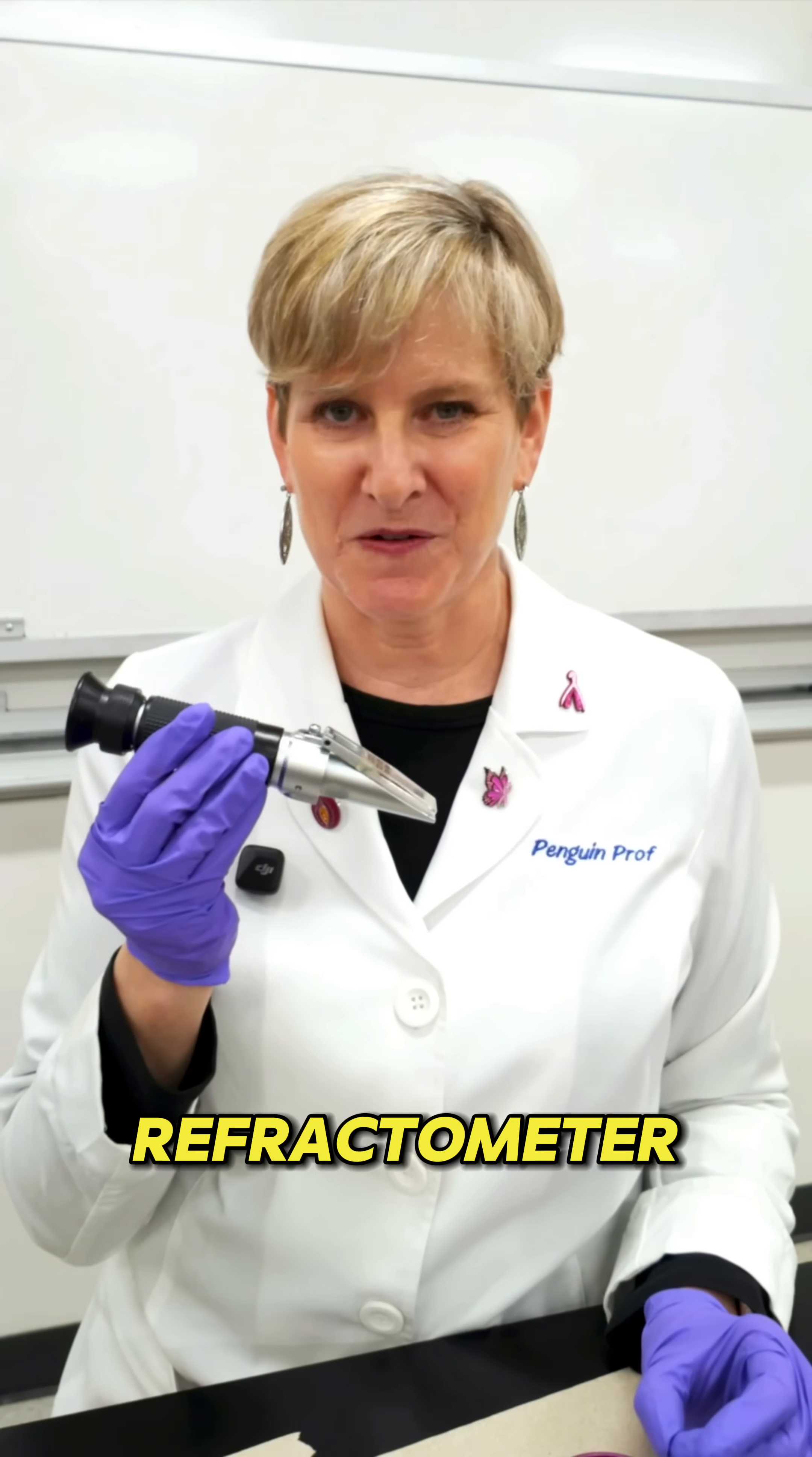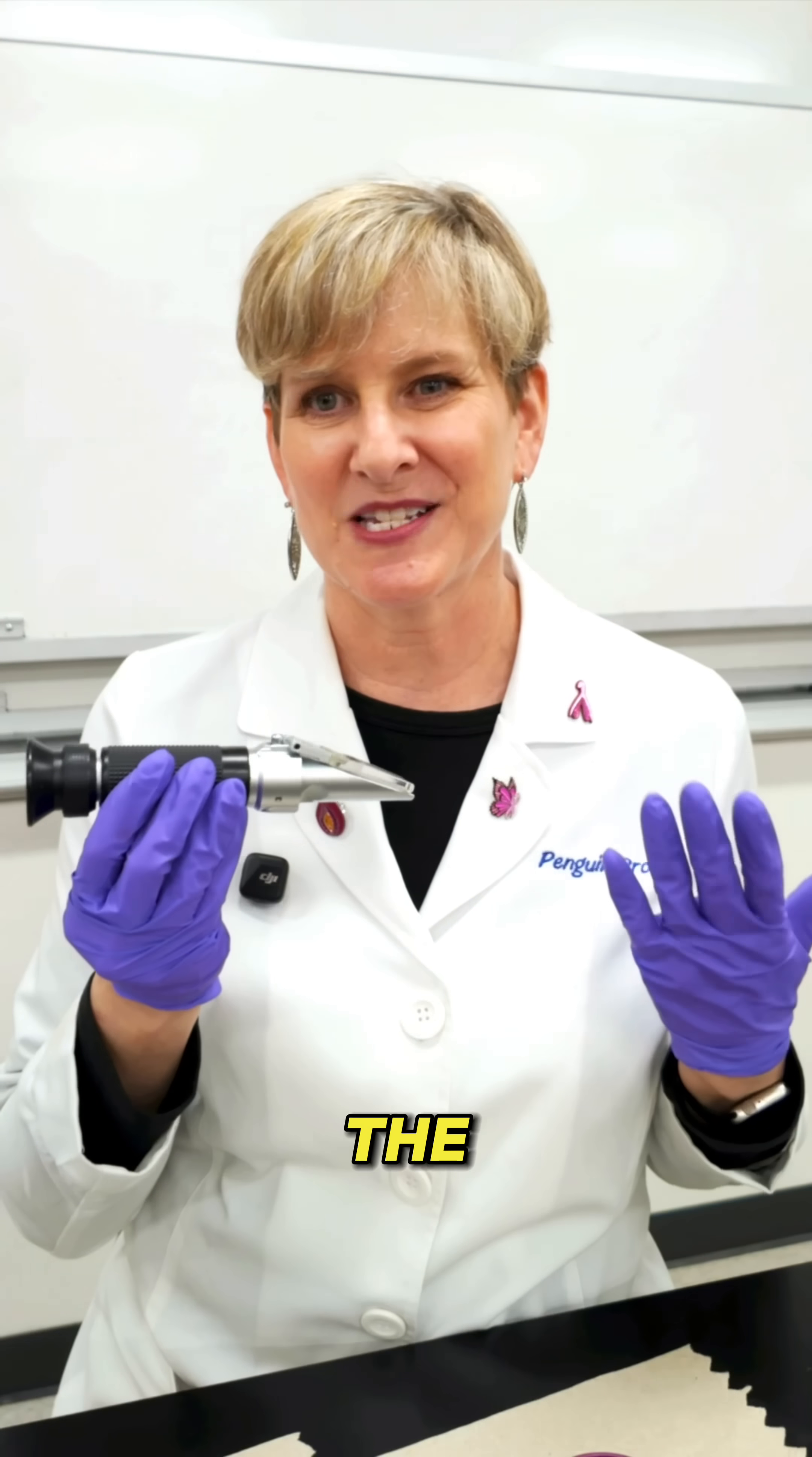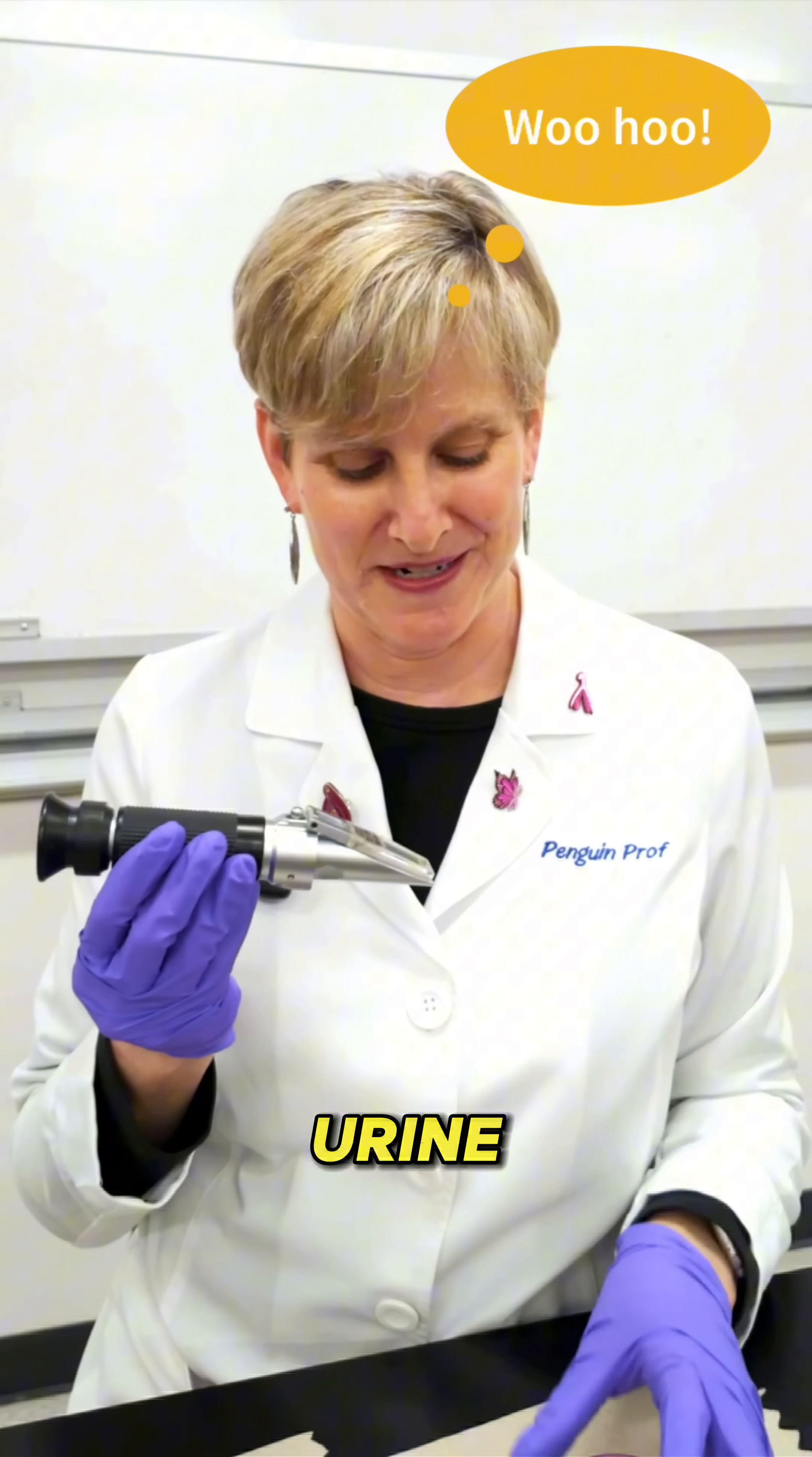Today I want to show you how to use a clinical refractometer. We use these in physiology to measure the specific gravity of urine.